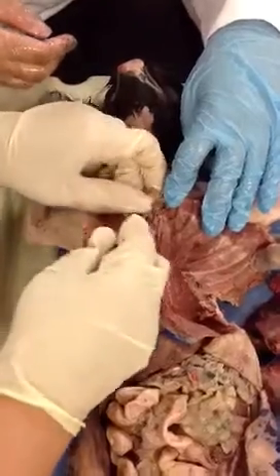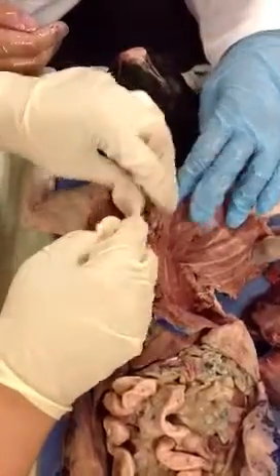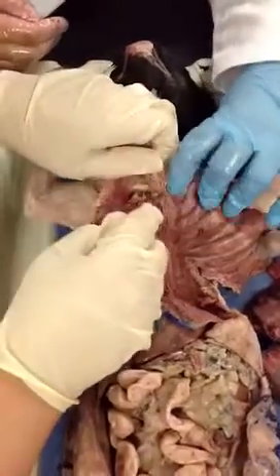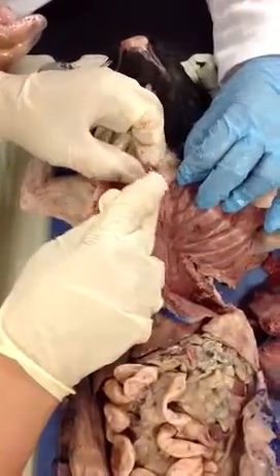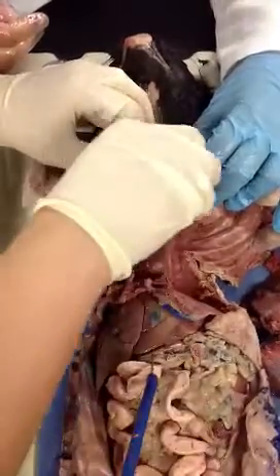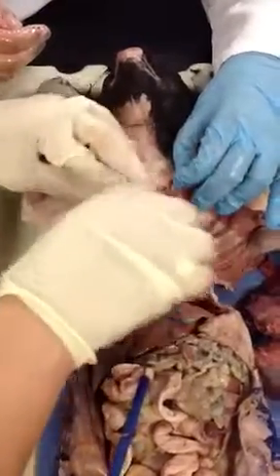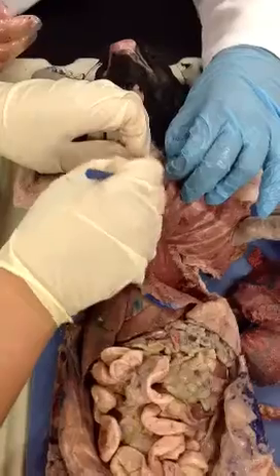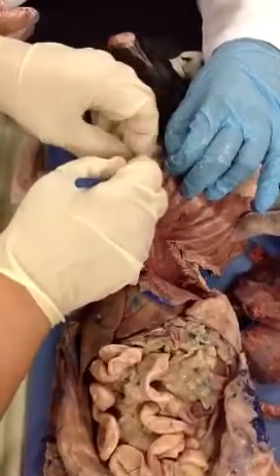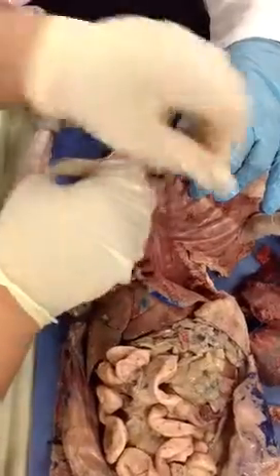Now for these carotids we're going to use the trachea as a point of reference, right? The trachea, what they call in layman's terms the windpipe, right? Let me see if I can preserve this blood vessel so we can see it later on. Boy, you didn't open it all the way up. I didn't know how far to go. And also try to preserve the veins because this is the same cat that we're going to use for the purpose of describing the veins.